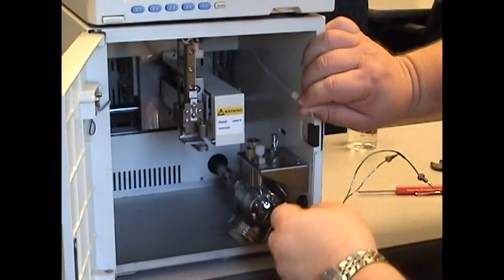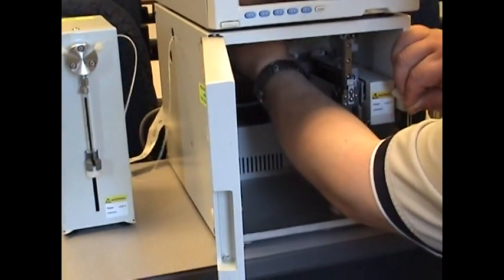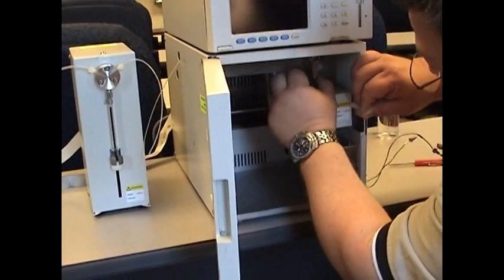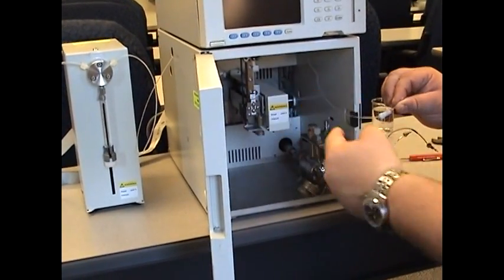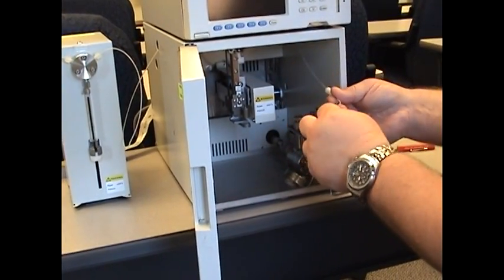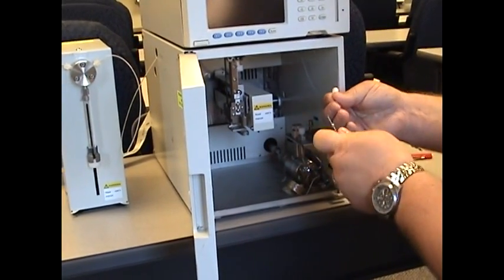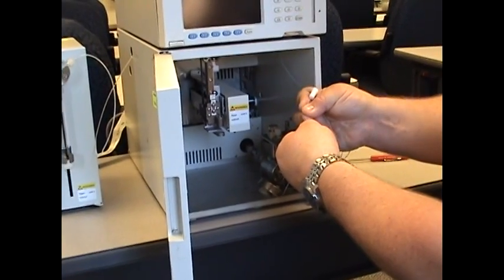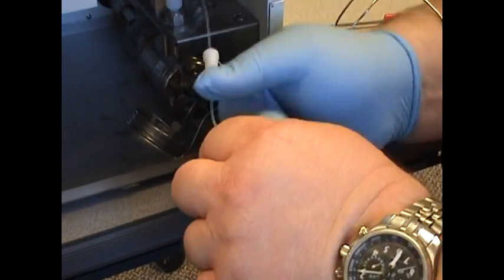If you clip that off, you're going to want to take some of this excess tubing and just gently pull it through. What we're doing is allowing for movement in the XYZ position. I just made a little more tubing, pulled it through gently to compensate for any piece that you may cut off here. Once that is done, you place the needle and the tubing on there. Push down.